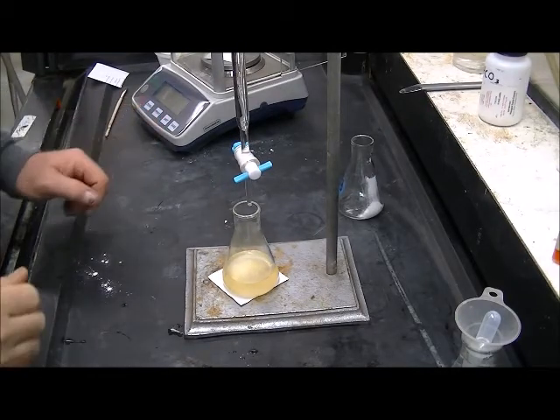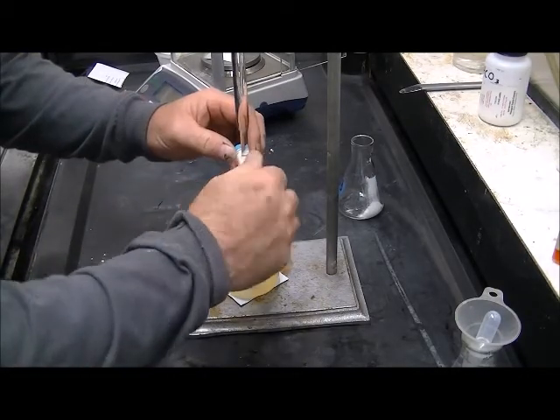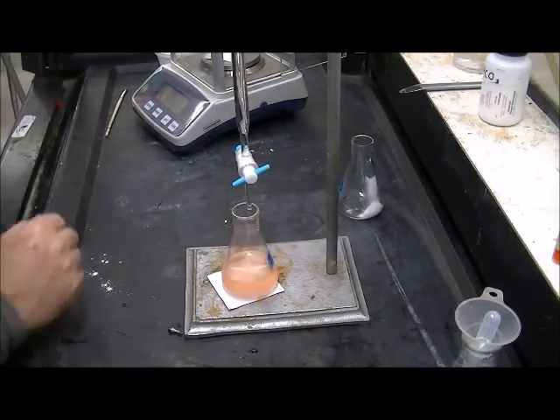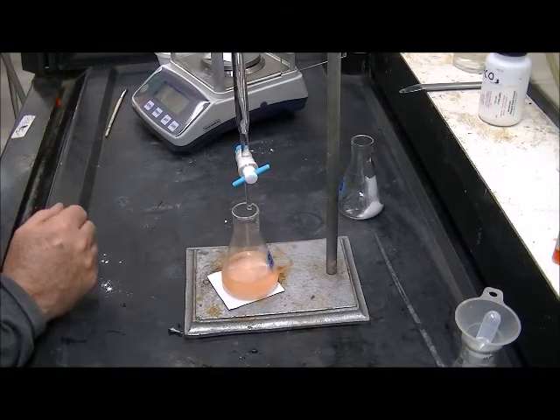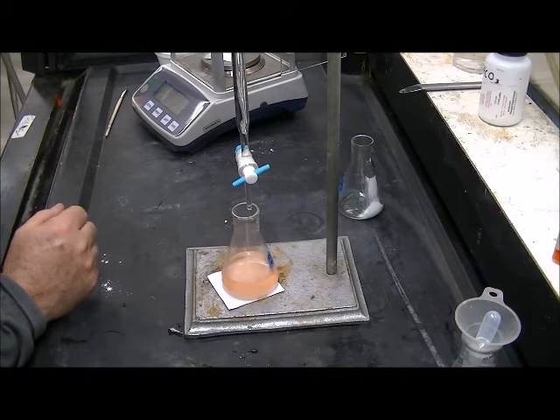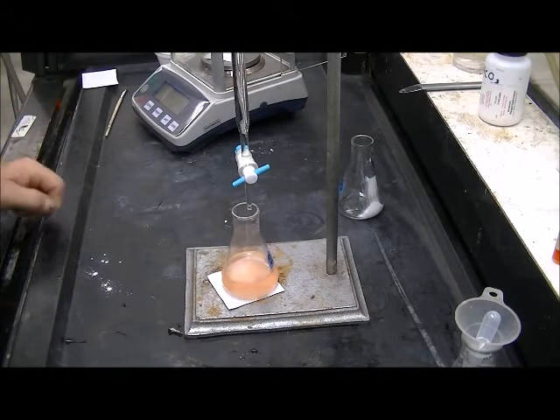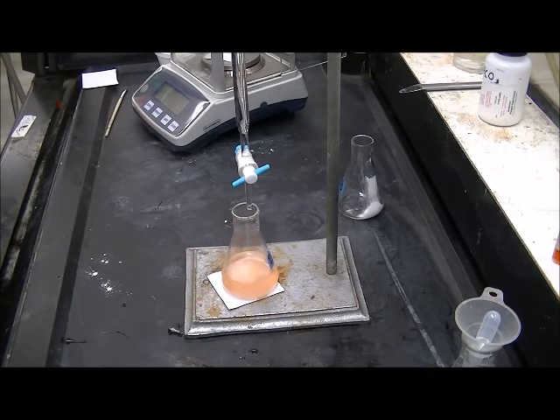Just finishing up with unknown D, sample 2. There we are. And the reading is 33.5, excuse me, 33, yes, 33.55 milliliters. 33.55 milliliters.